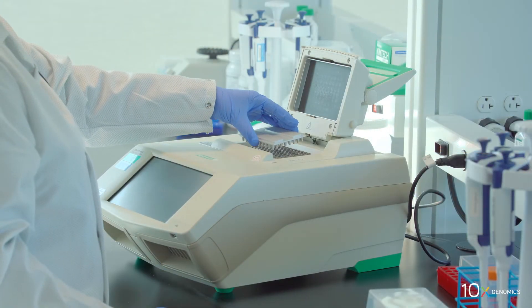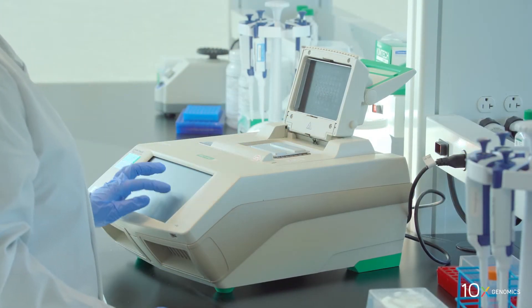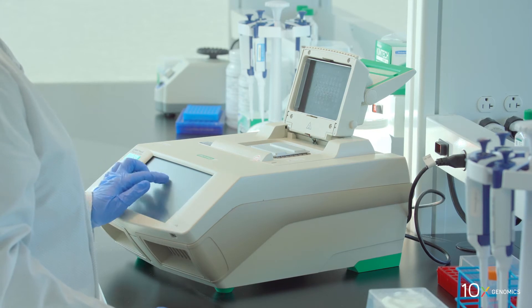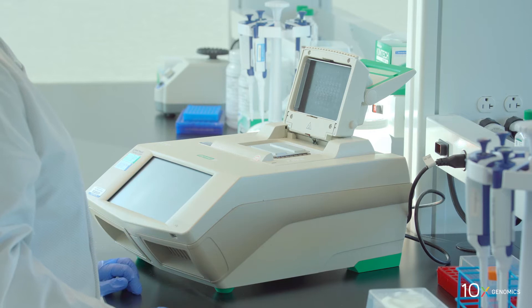Place a thermocycler adapter on a thermal cycler set to 37 degrees Celsius and equilibrate for five minutes. Heating the thermocycler lid is not required.